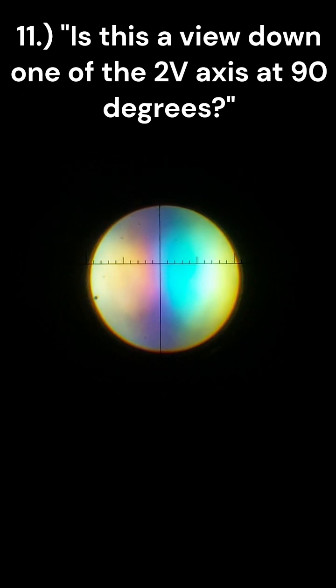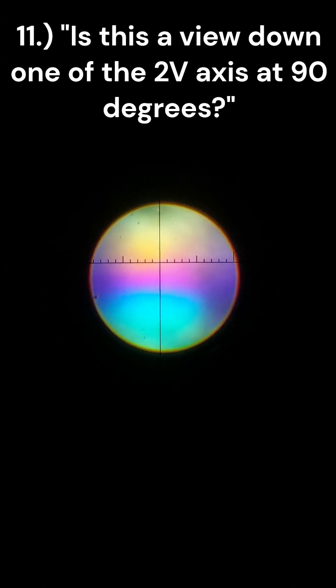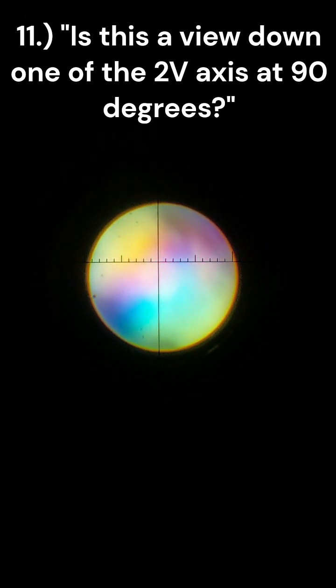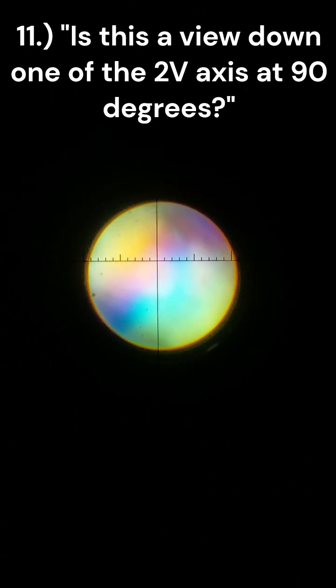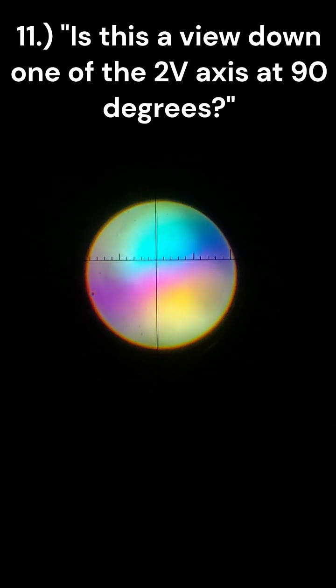Spinning this counterclockwise 90 degrees, another 90 degrees, just kind of continuously rotate it. This seems like a biaxial on its side, which is to say going perpendicular to the optic axis. I'd like to know if that is correct.